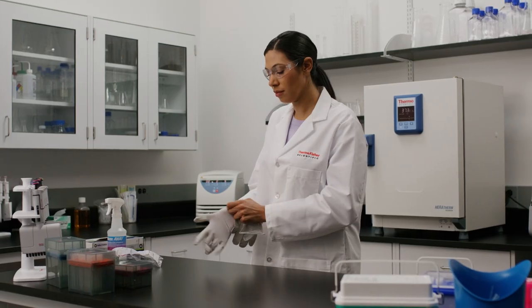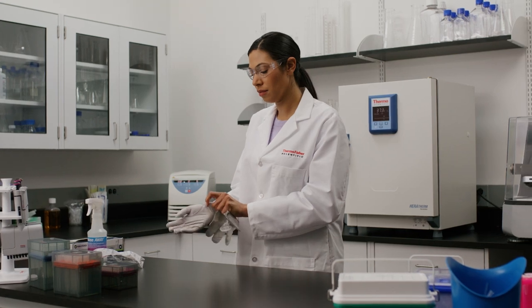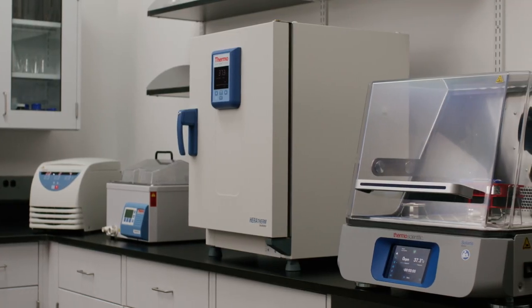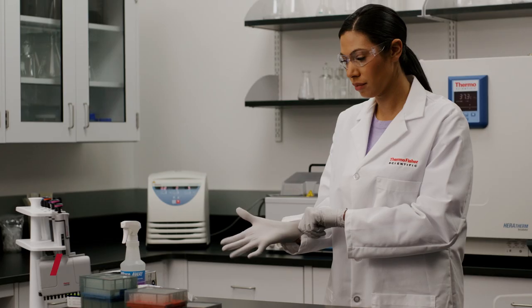Today we meet Maria, who is helping us complete a DNA cloning protocol using only ThermoScientific laboratory equipment and consumables. Let's see what she's up to.